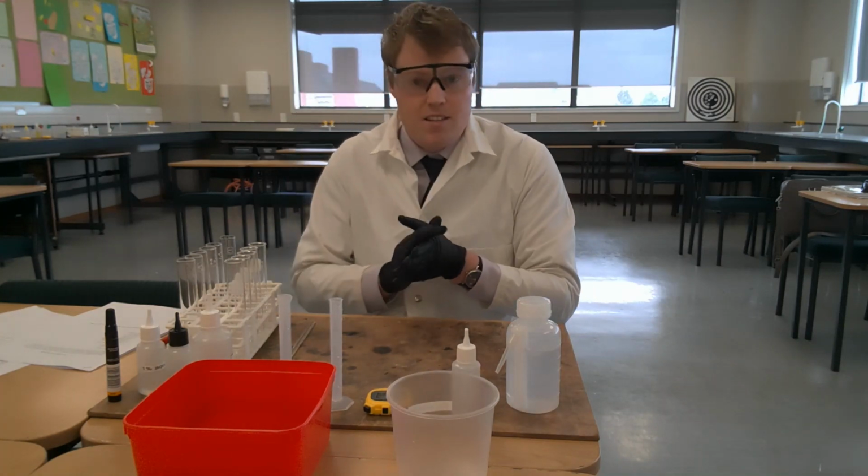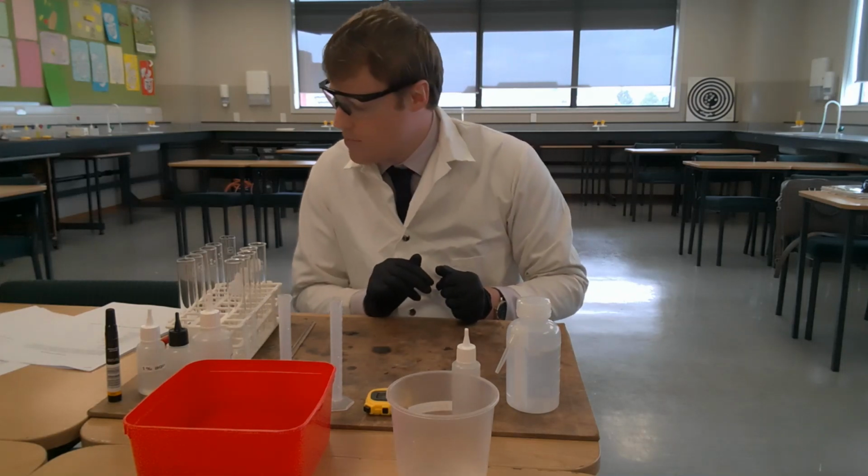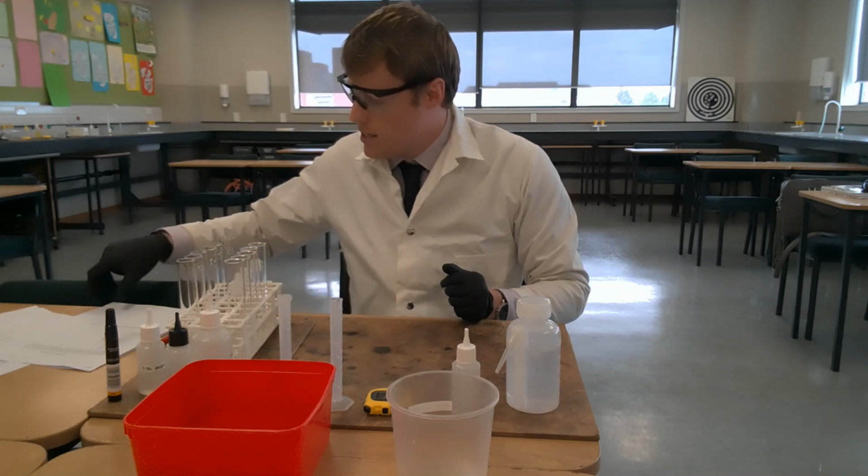Make sure that you have a piece of blank paper next to you so you can record the results down as you watch this video. And let's get started.